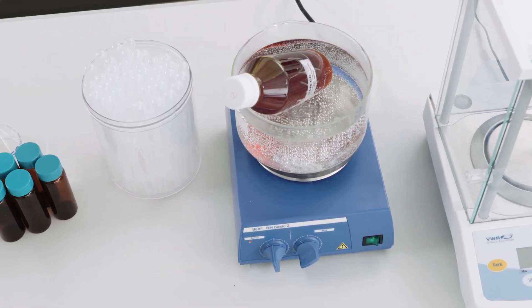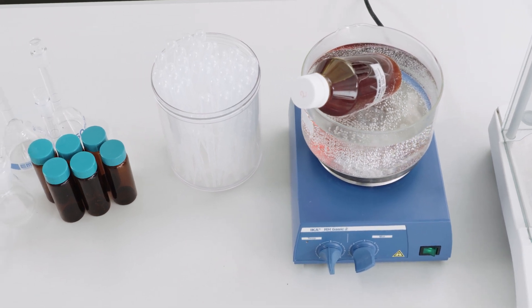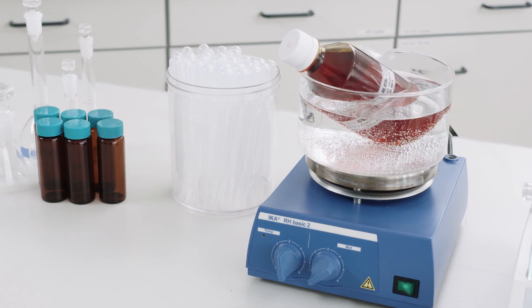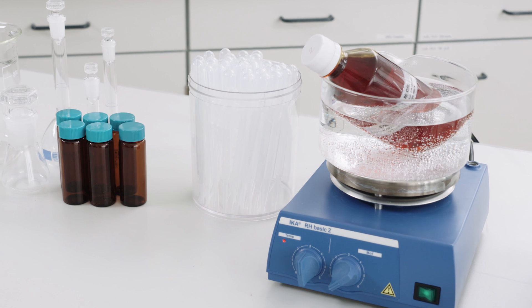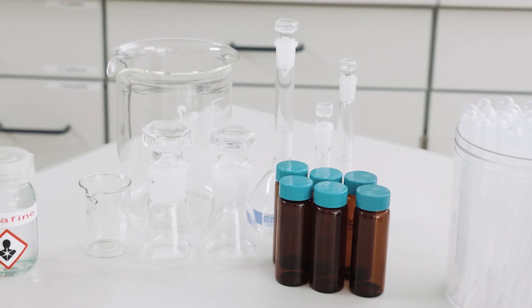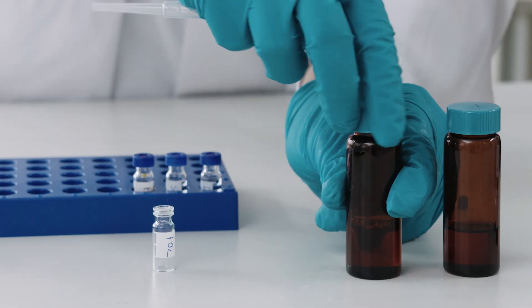First and foremost, the selection of appropriate tools is on the agenda — they need to be clean and resistant against organic materials. Transfer pipettes or disposable Pasteur pipettes are used for standard and sample handling; this is ideal for viscous materials, allowing easy and clean sample taking while eliminating the risk of contamination and spillage. When selecting sample vessels, pay attention to resistance to organic materials, leak tightness, and nominal volume, as this prevents loss of analyte. Suitable lids should have seals resistant to solvents that do not bleed out the element of interest.